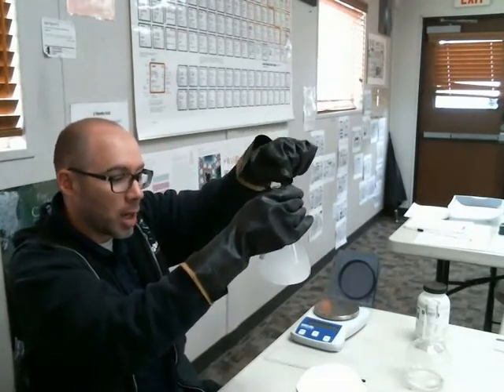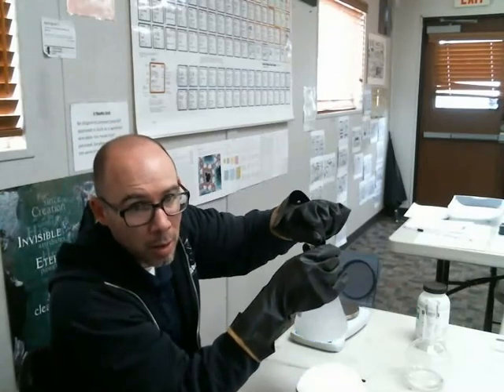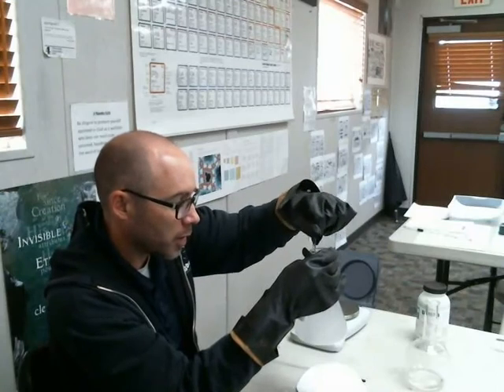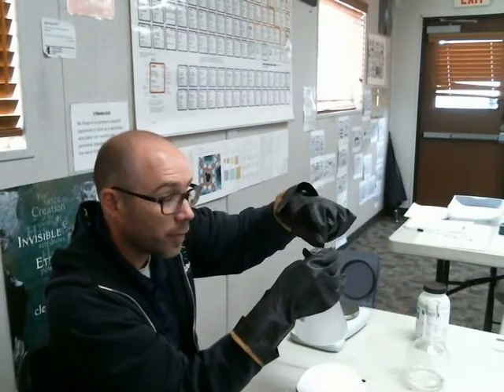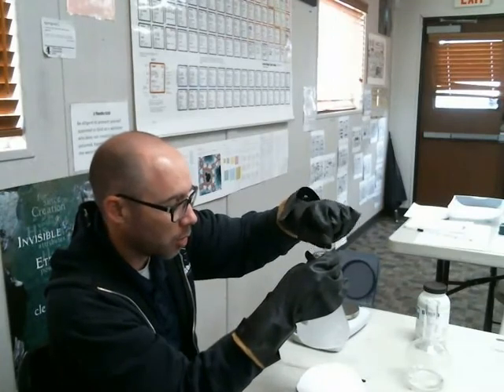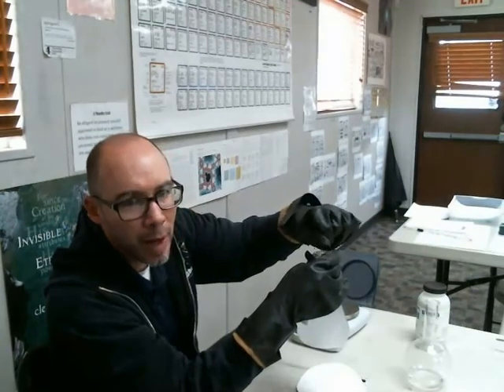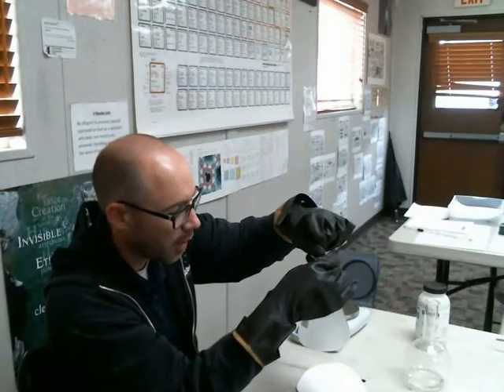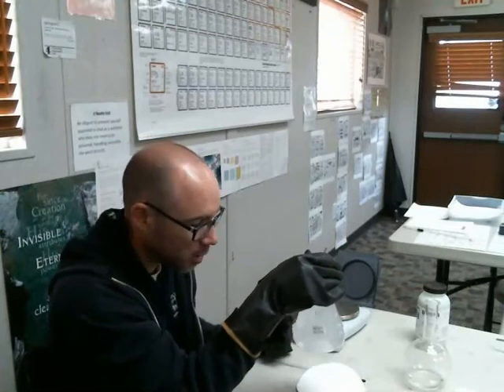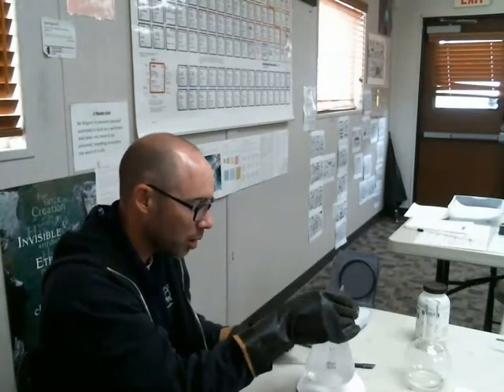And we know now that we've weighed it out, we know that we've got enough in here to give us a concentration of, if there was 1 full liter, we would have half of a mole in this solution. We only have half of a liter, so we need only half of that. And once it's all dissolved, some things take longer than others, and we can use it with fairly accurate calculations.